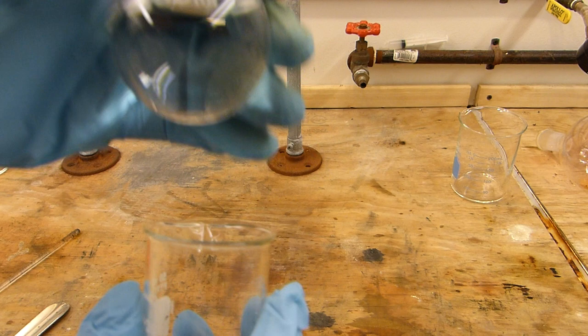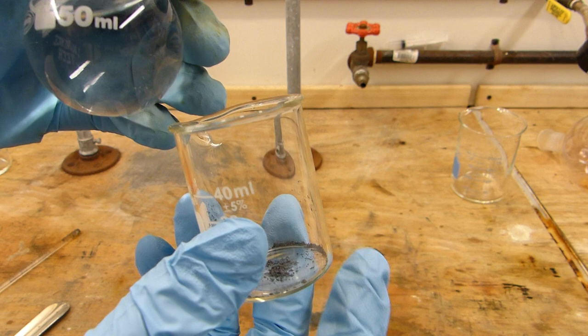And condense it or deposit it as it's called on the bottom of this flask. And that redeposited iodine is actually very very pure. And that's how you purify and dry your iodine.